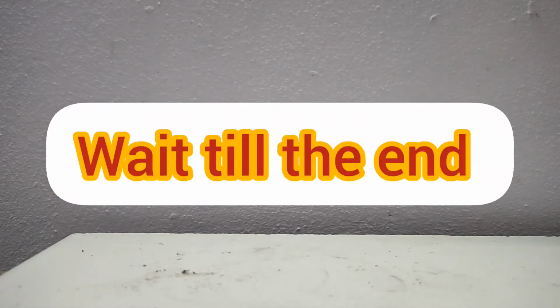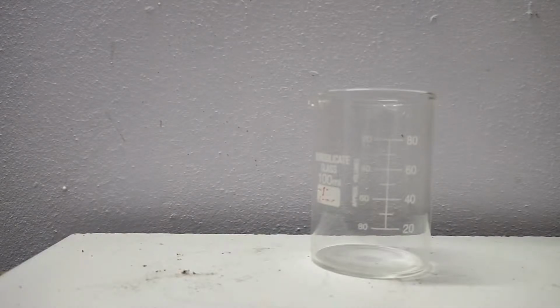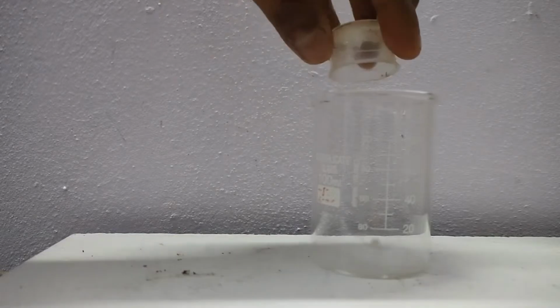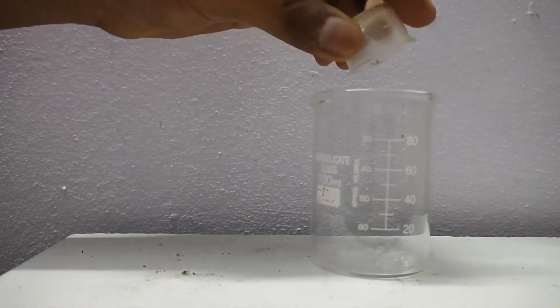So in this video, I'll be showing you an indoor sunset. For that, in a beaker, I am taking 1.2 grams of sodium thiosulfate and dissolving it in 80 ml of water.